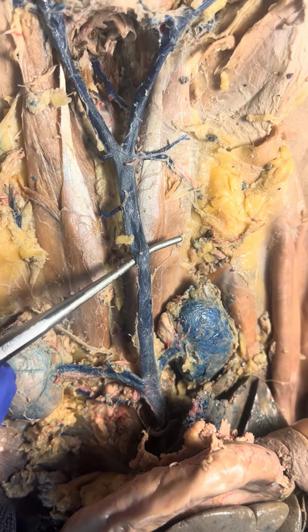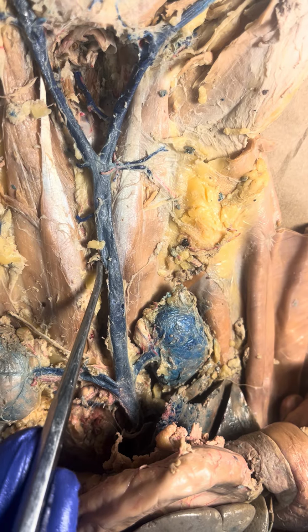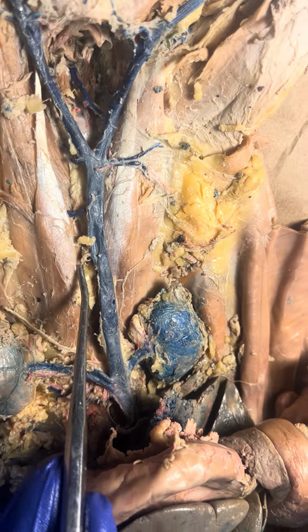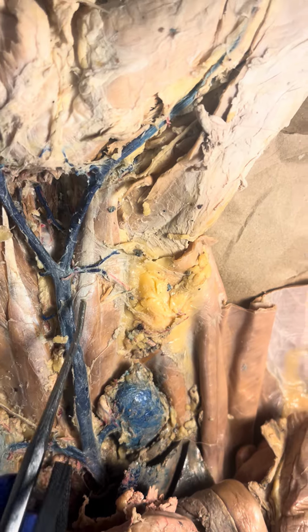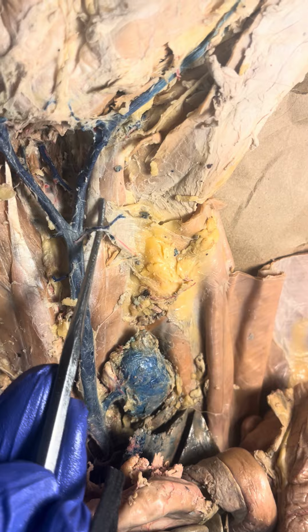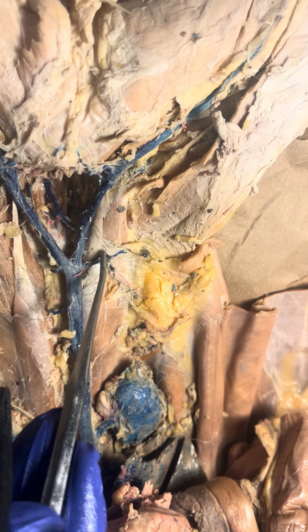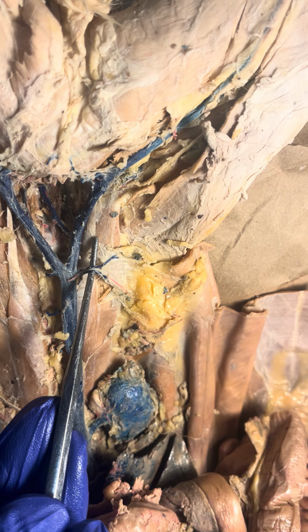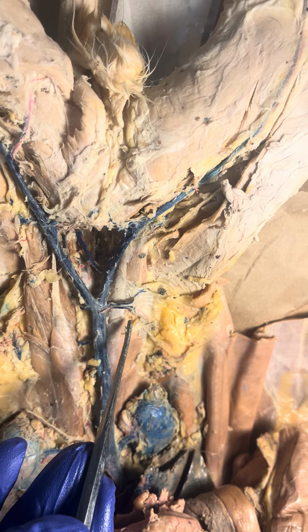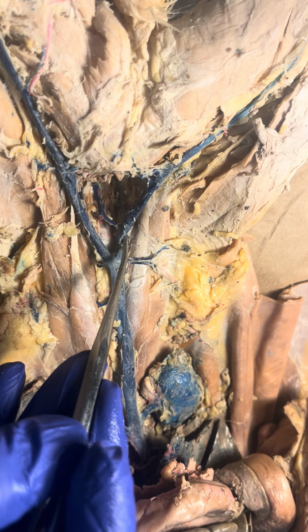And then continuing down, I should see the gonadal veins, the spermatic or ovarian. And again, there's a left and a right, but these are broken. Maybe this is a spermatic or ovarian vein, but I wouldn't count on it. So I don't really see those well here, but I do see a beautiful iliolumbar vein. So again, these are left and right, and I can see that the left side is broken. But here's the right iliolumbar vein, which goes to the ilium, drains blood from the ilium and from the lumbar region.